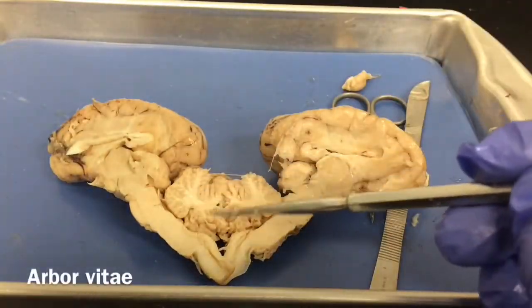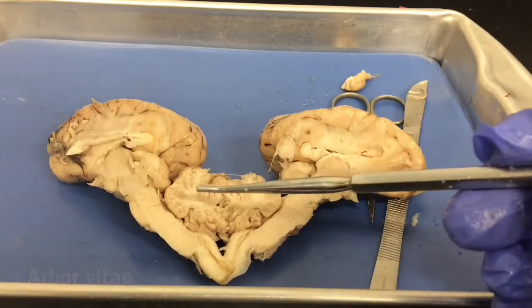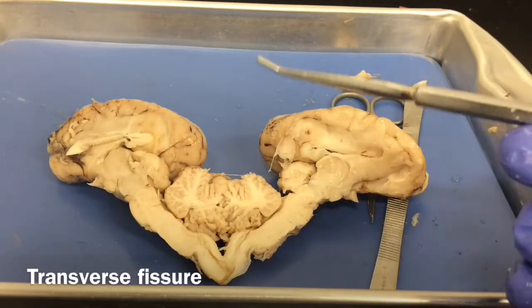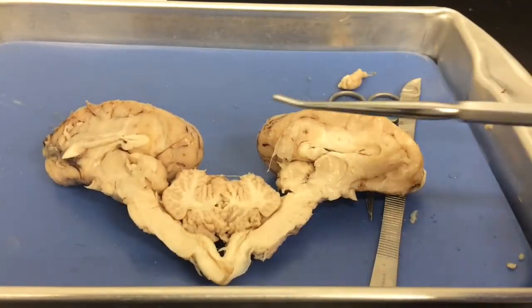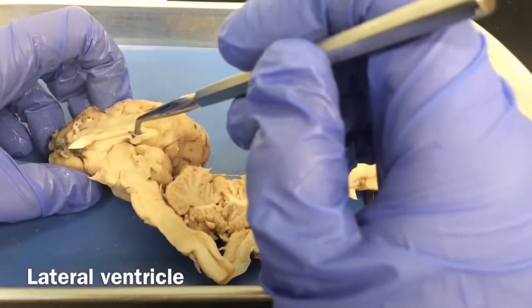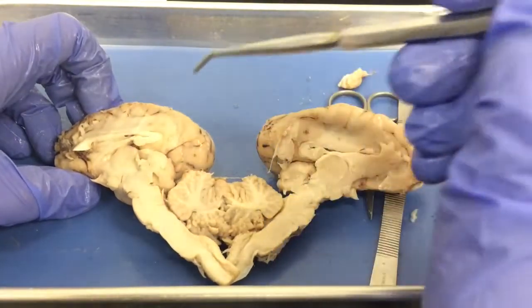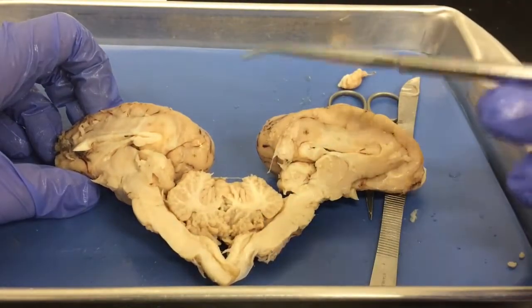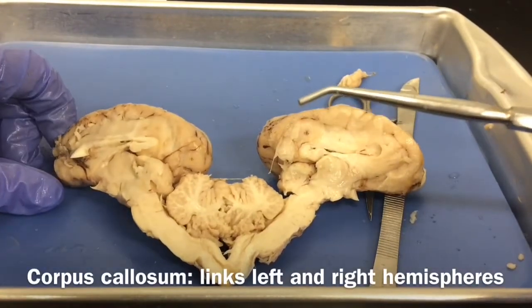Okay, so now we can see our arbor vitae, our tree of life, inside our cerebellum, and this part between the cerebrum and cerebellum, again, is called the transverse fissure, so that's here. And remember, the cerebellum is only loosely connected, so if it falls off, that's hard. So here we have our lateral ventricle. We can actually stick our probe inside. And that's going to be sort of right next to our corpus callosum. And remember, that's going to link the left and right hemispheres in order to allow for communication.